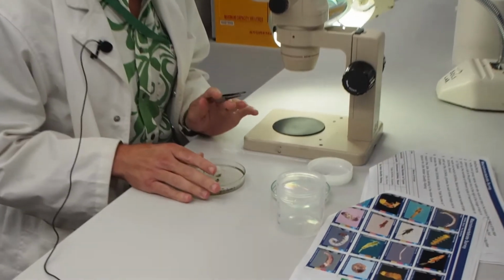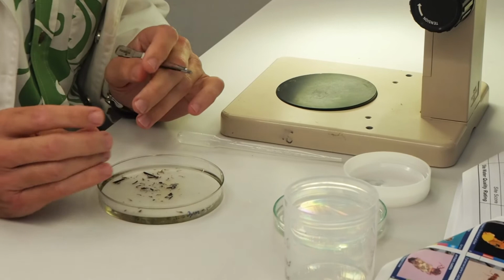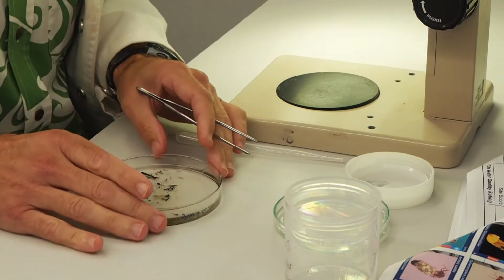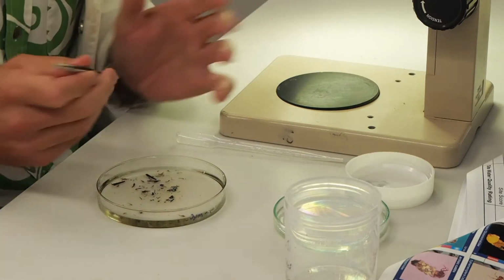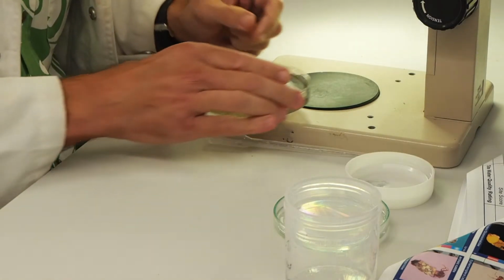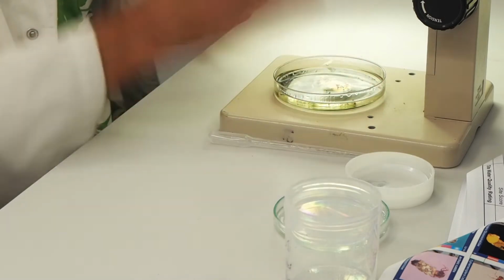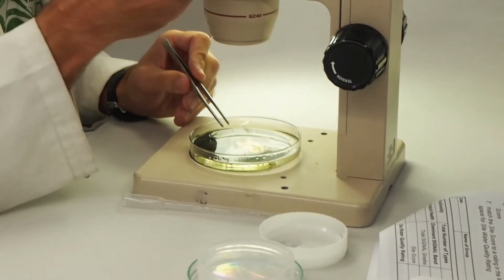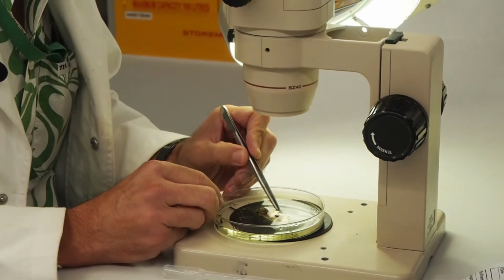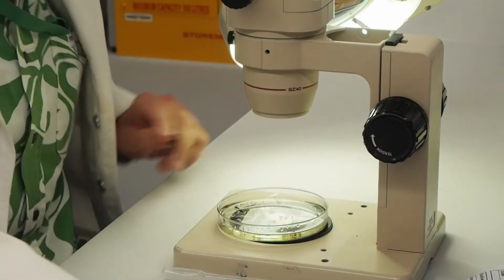What we then need to do is identify what groups of organisms they belong to, and how many. While I mentioned in the field that we're not after an exact number, relative numbers are important, because that helps us understand the relative abundances of these organisms. I've got a light microscope here, and I'm checking under there, and I see lots of little critters. So what are they, and how are we going to identify them?